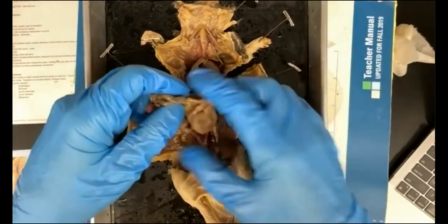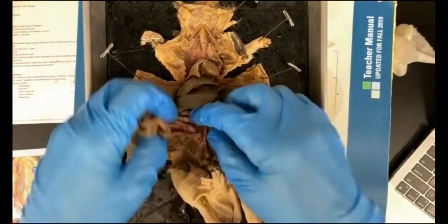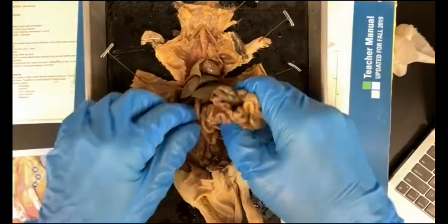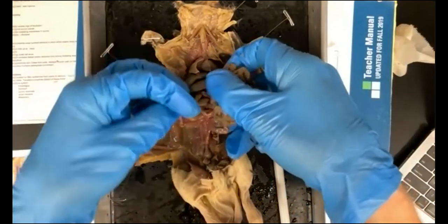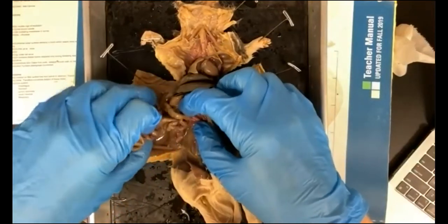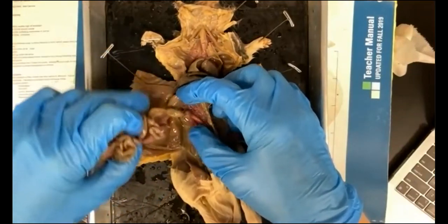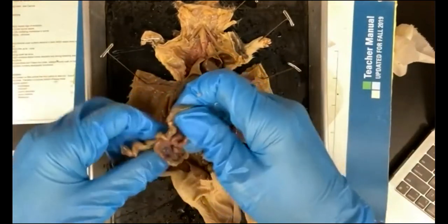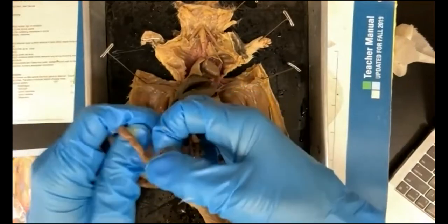and then they will go to the rest of your body. Okay, so we're just going to slightly pull at this so that you can get it out of the body cavity itself. You will just gently tear at the mesentery until it just pulls itself away. And then if we want to measure this out, again, we're going to have to just very gently break through the mesentery with your fingers.